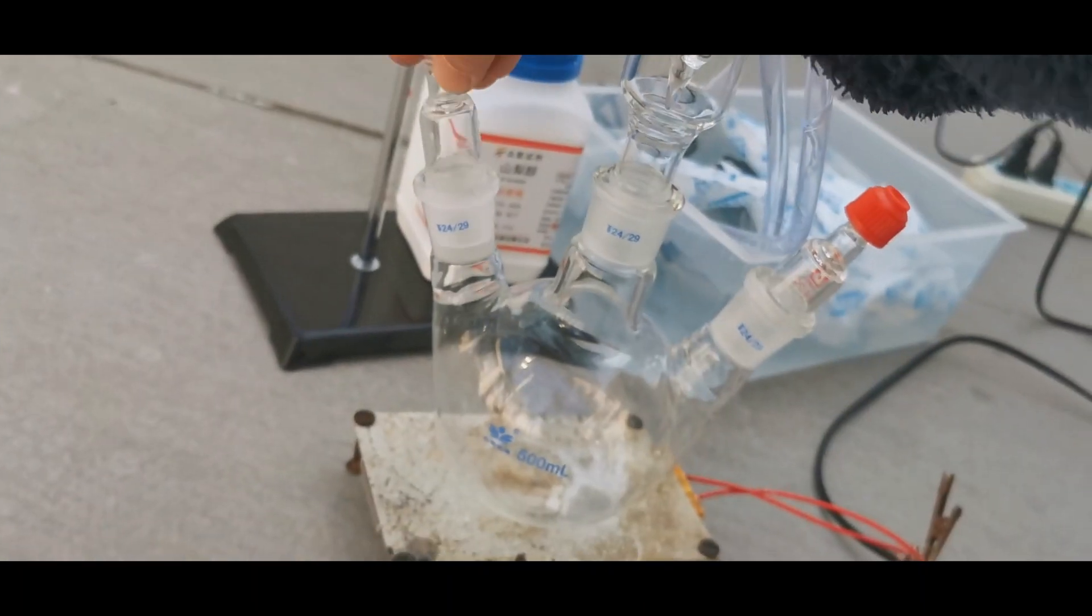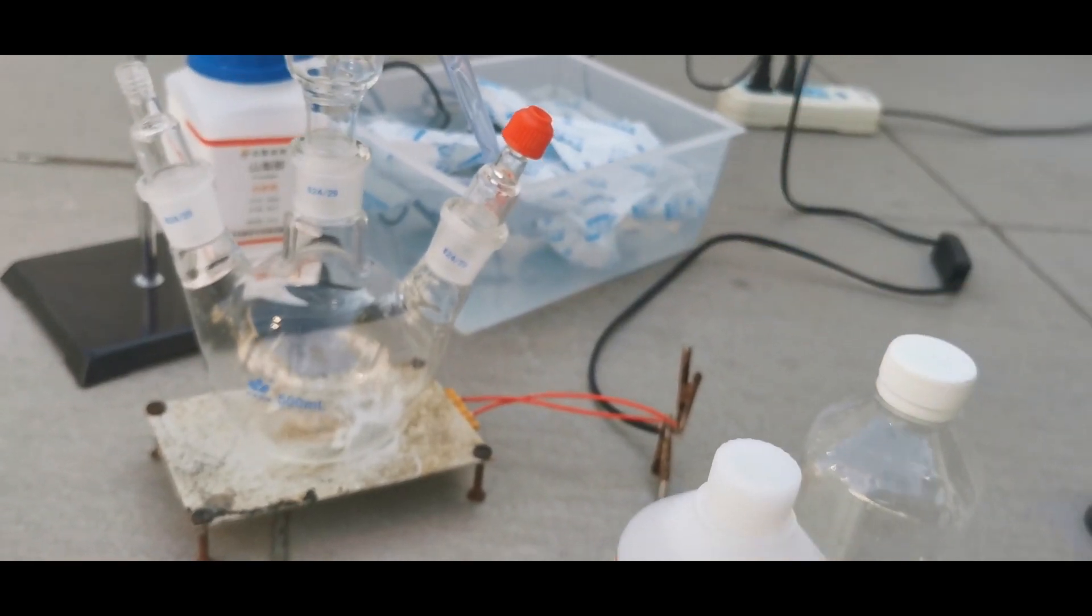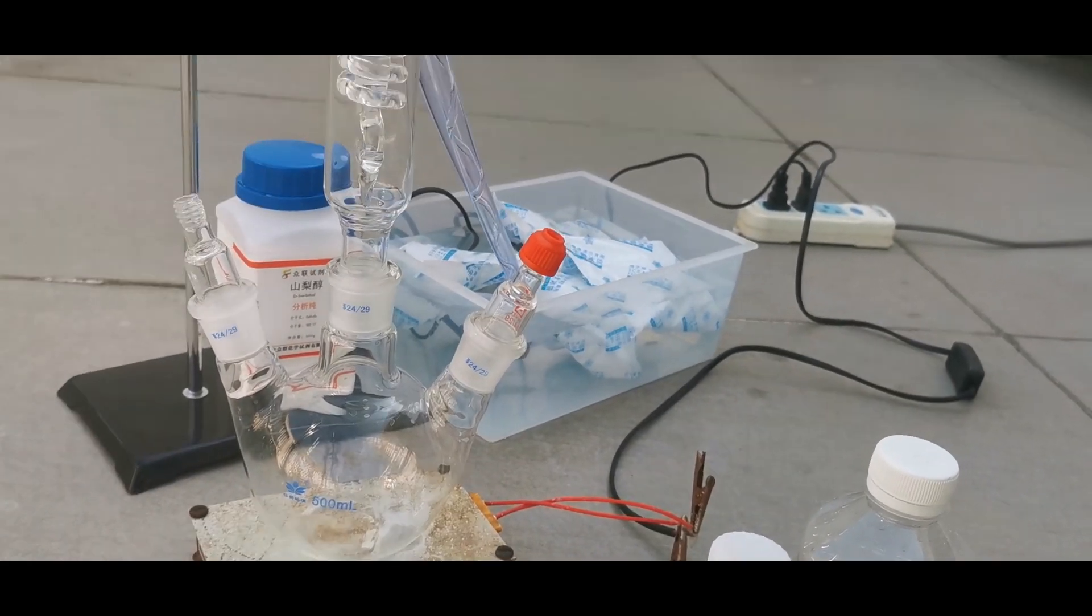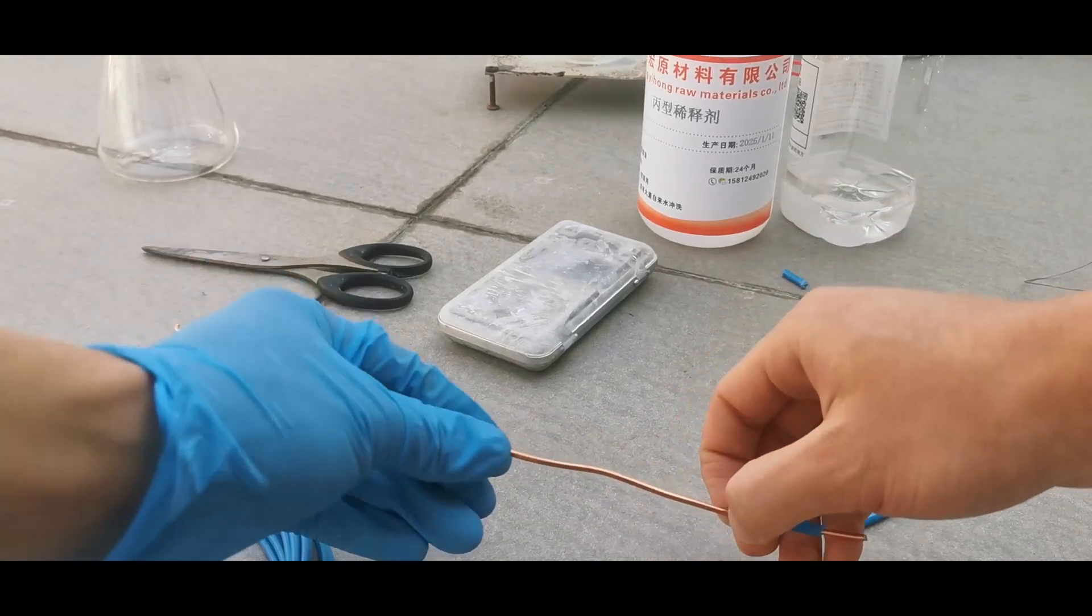The plan is to put a piece of filament between the two side joints of the flask, and the ketene produced from the pyrolysis of acetone would flow up the condenser and to the conical flask through a tube. Now to actually put the apparatus together.